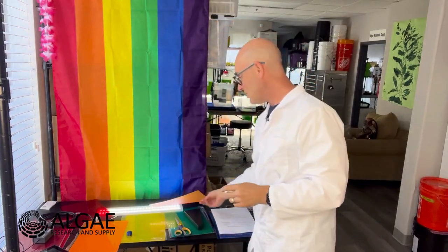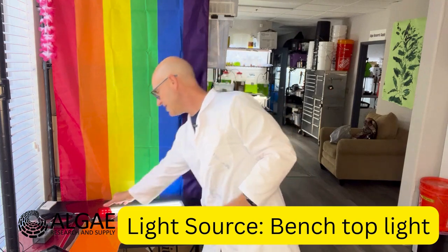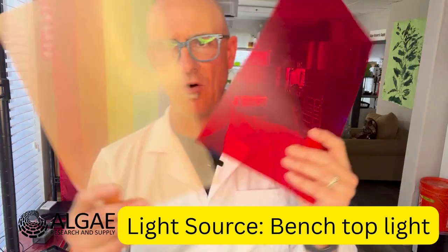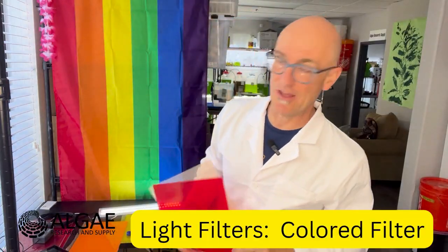So what we're going to do is we have one of our benchtop lights here. This is one of our algae lights that we manufacture. And from the fine people at Amazon, I picked up a whole bunch of different colored screens. These would be filters. If you're in theater, they would have been called a gel.